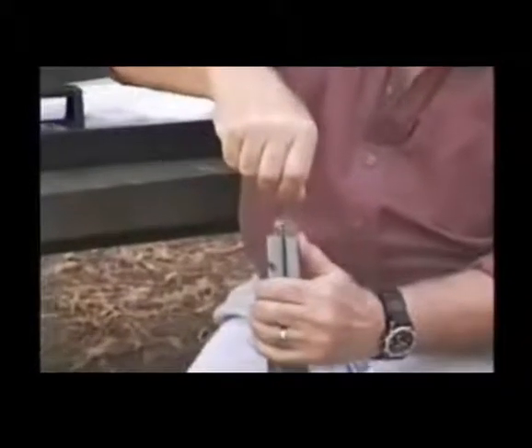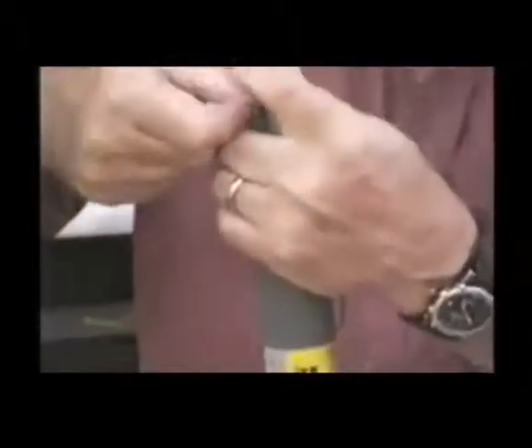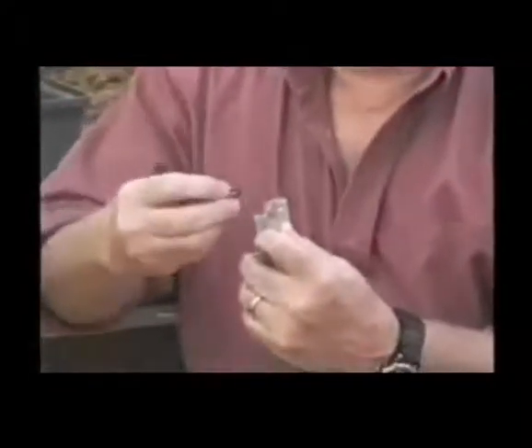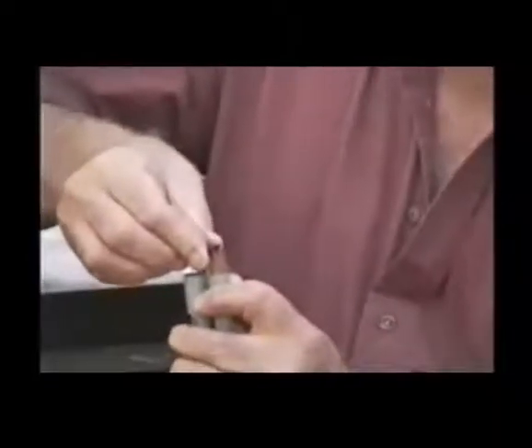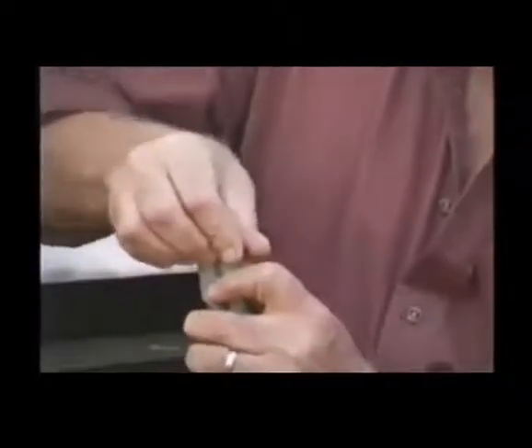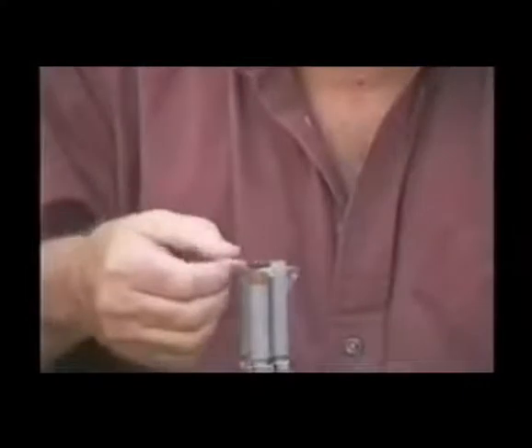You then put the membrane on the side of the probe, hold it down firmly with your thumb, and then stretch the membrane across the top of the probe, securing it with your other finger. You then, without again touching the surface of the membrane, roll an O-ring on with your fingers, like that. You then see the membrane has a lot of extra on here. You make sure that the membrane is nice and taut, there's no bubbles, there's no wrinkles.